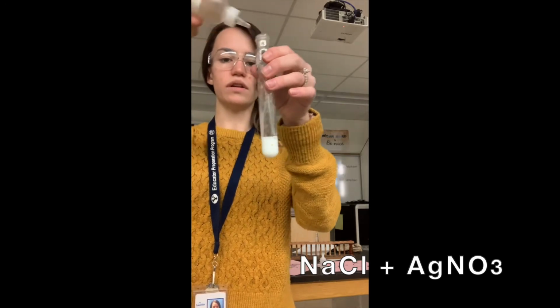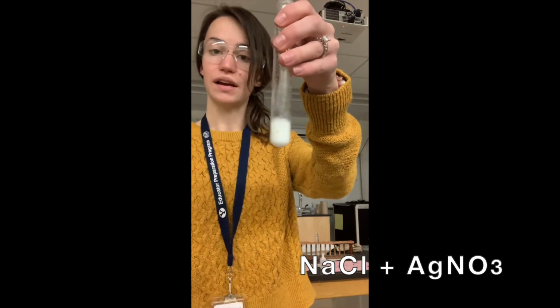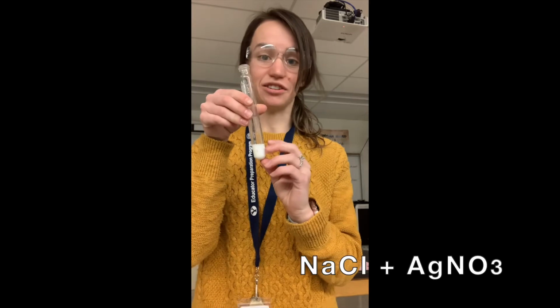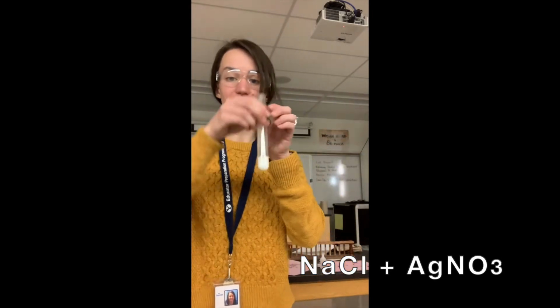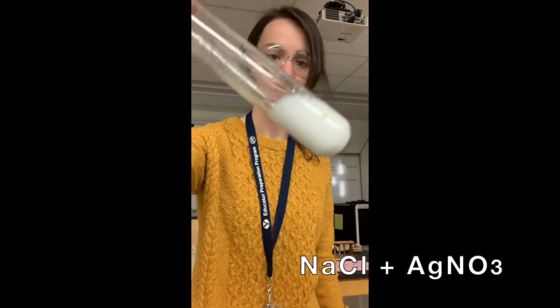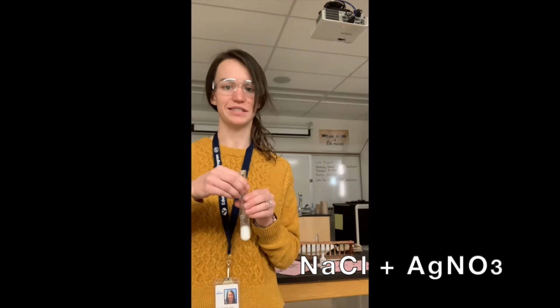Alright, so we took two clear liquids. And now you can kind of see that it is this solid white color. If we actually were to strain this, we'd even see some chunks in there too. So you can make the color observation and also talk about how it's forming some chunks. How it's just not a liquid anymore, but it has some solid parts in it as well.